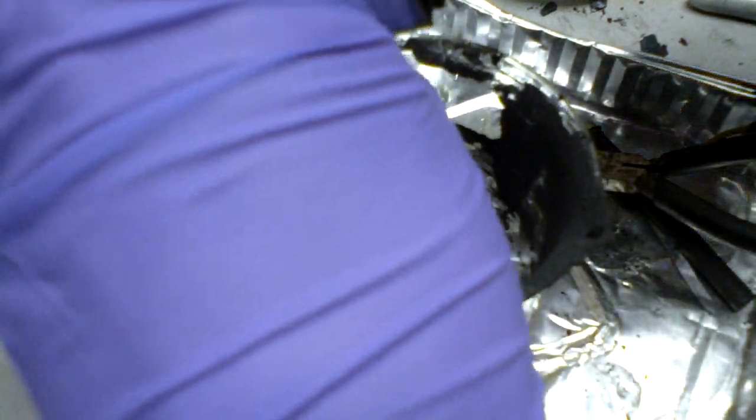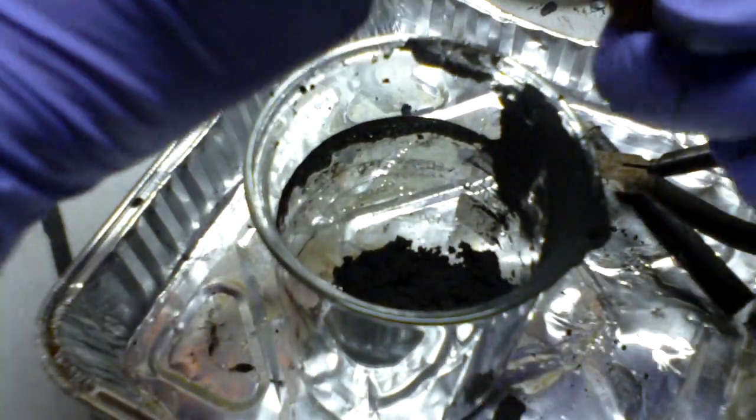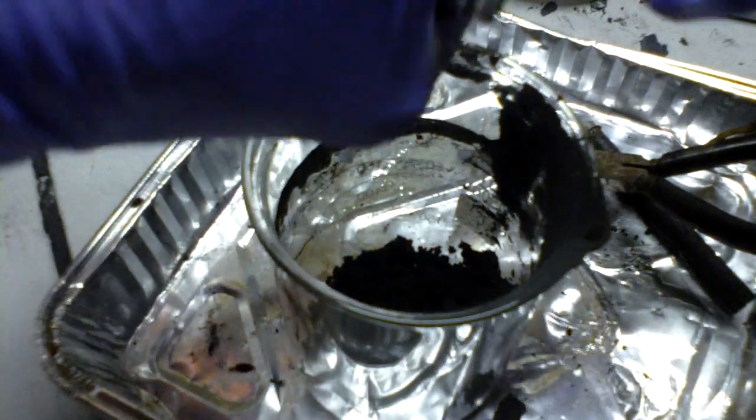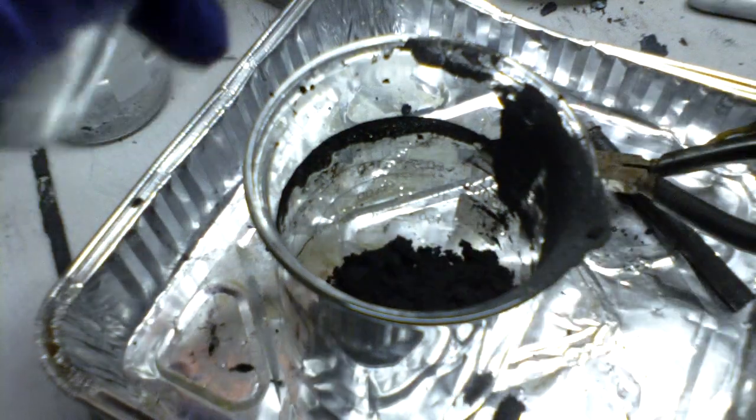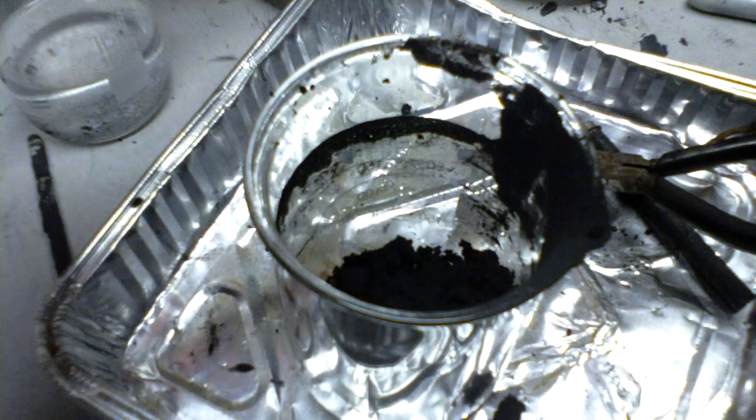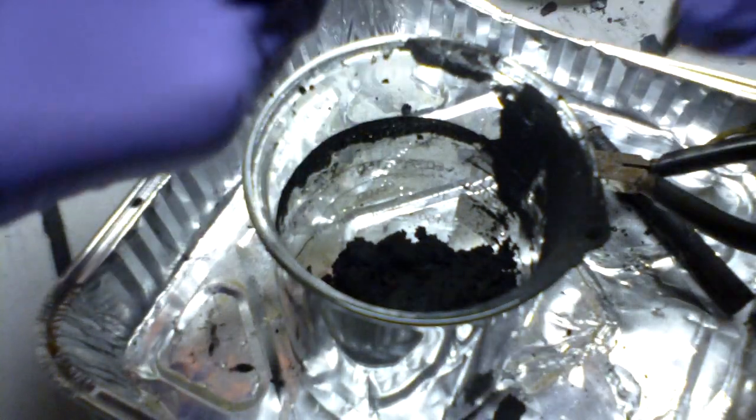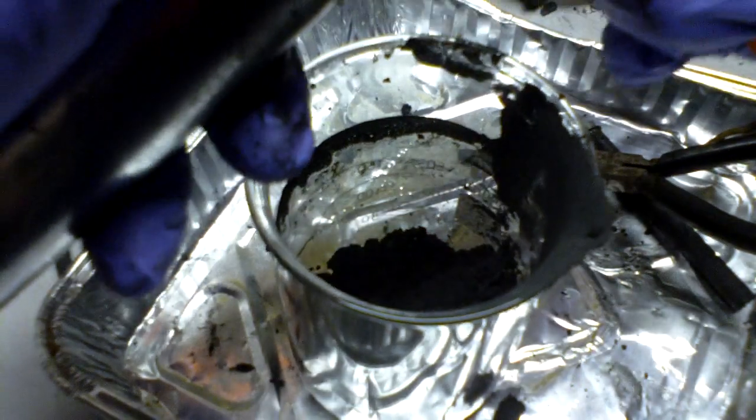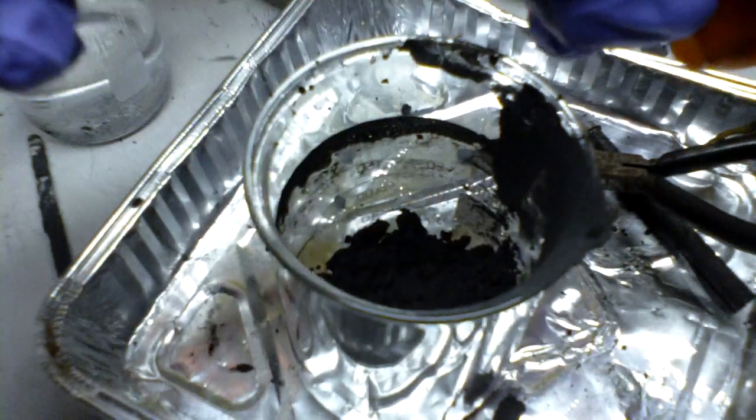The battery may start heating up during this part because you're removing the paper which is keeping the battery from shorting itself out. And once you do that it may start to heat up, so just work faster from there. I can feel it starting to heat up now, gonna have to work faster.